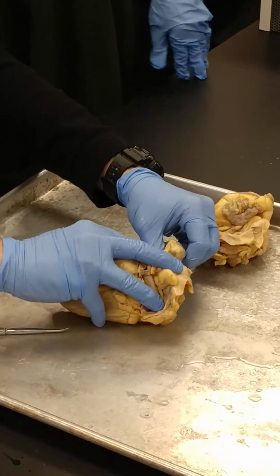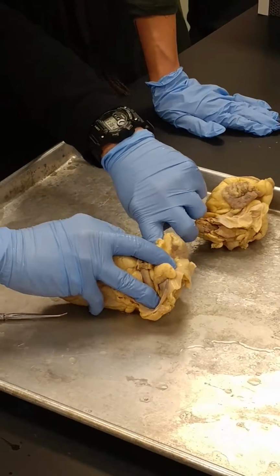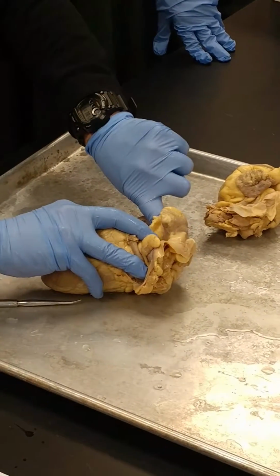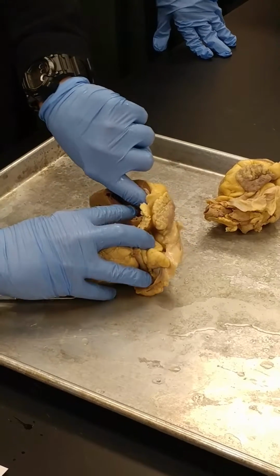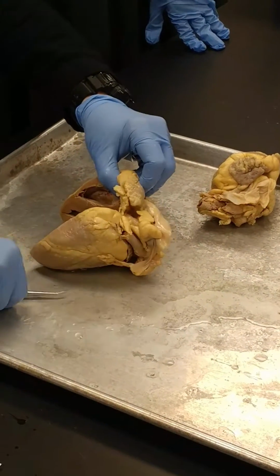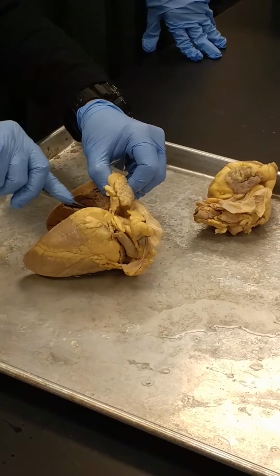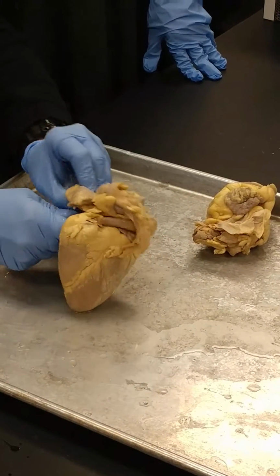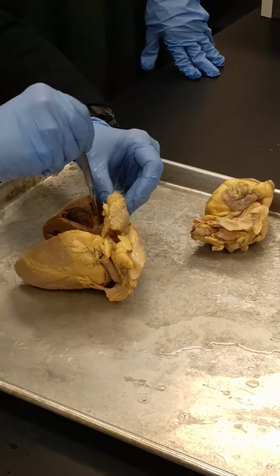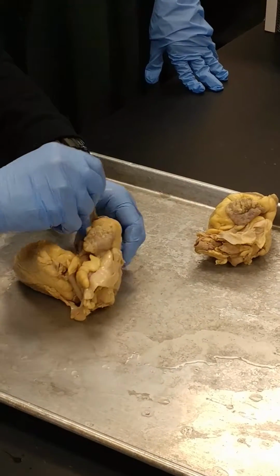Kristen, if you look, you can kind of see there's a hole right here. And maybe some of you asked to see yours, but see that hole right there where you can see through it? See the light? Y'all see the light back there too? Okay? Right next to that hole is another hole down in this direction. So I'll stick the probe up through the hole. There it is. But I'm going to go right through here, right next to that hole. And that's the coronary sinus.